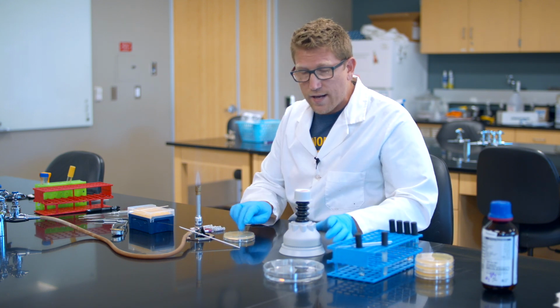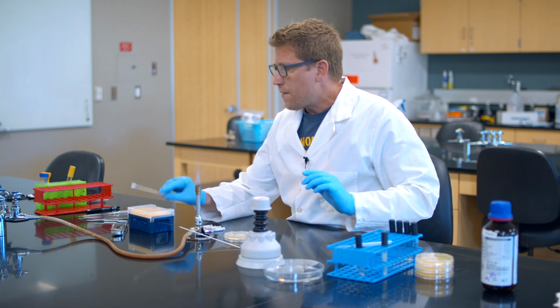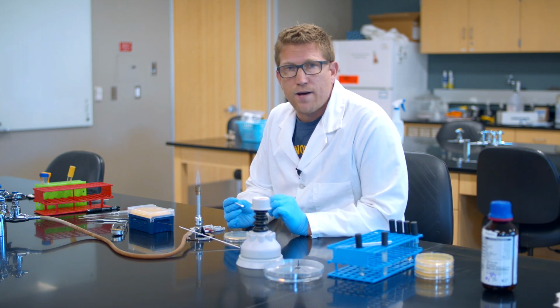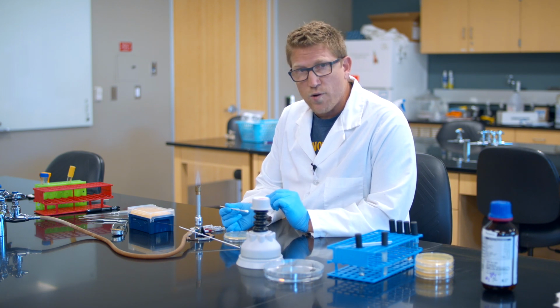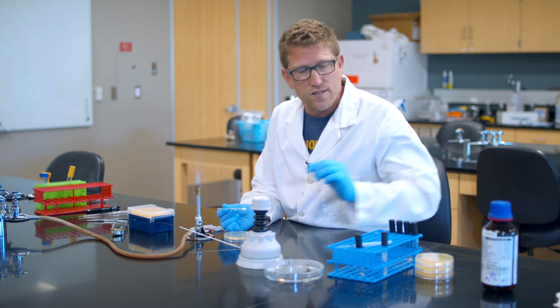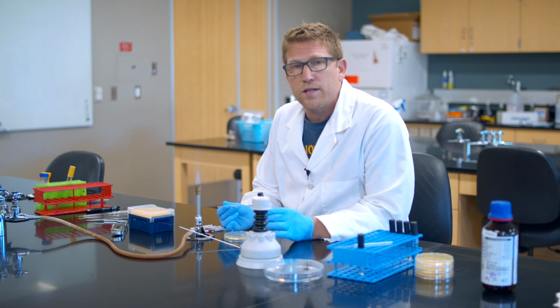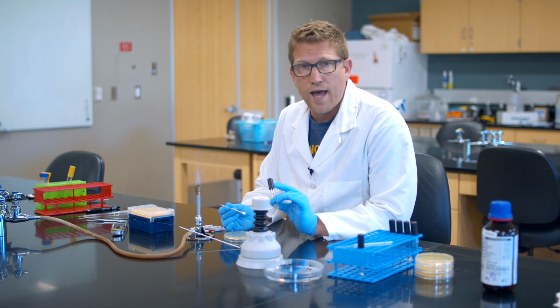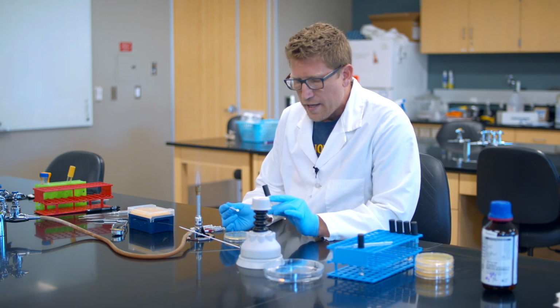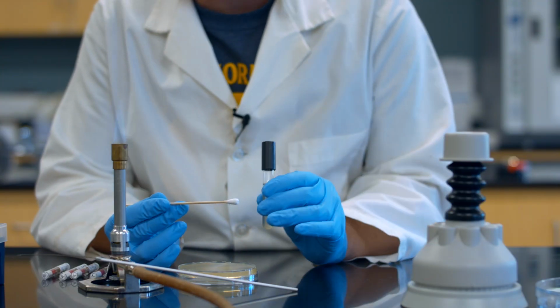So let's start with creating a lawn. There are lots of different ways to make a lawn, but the standard method for antibiotic disk susceptibility testing is to use a sterile cotton swab. And I took this out of a package. This is sterile. And then a broth of your bacteria that's been properly diluted out. And I haven't gone to the trouble of diluting this one out because it's a demonstration, but it needs to be diluted to a very specific turbidity or cell density.